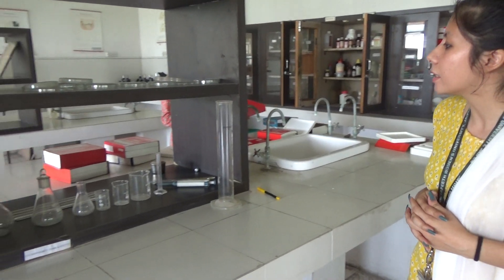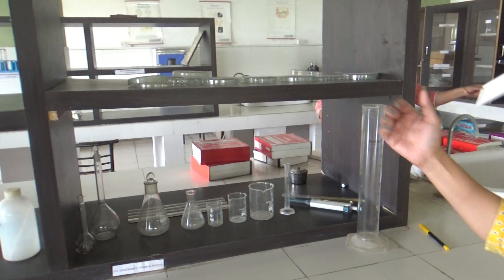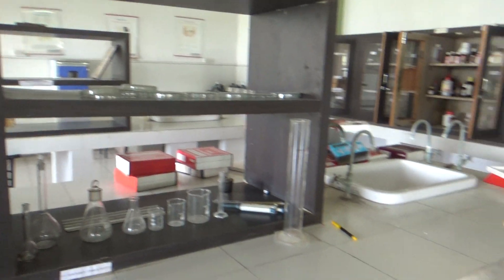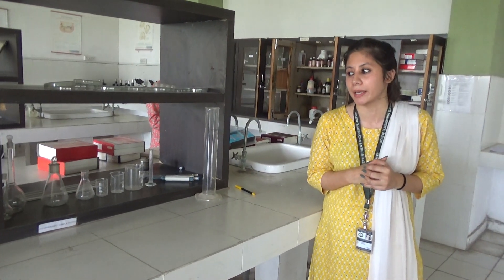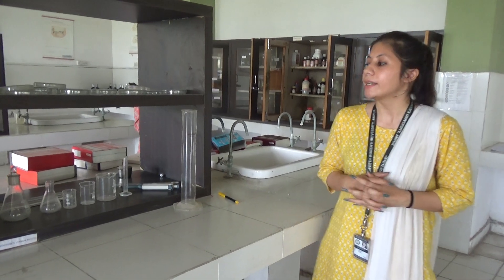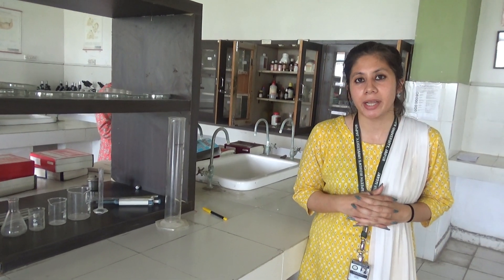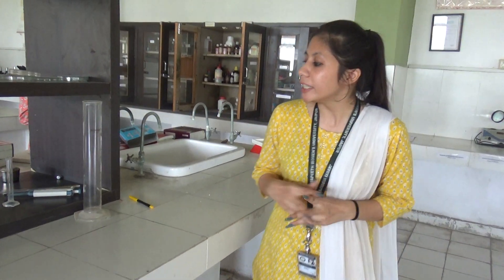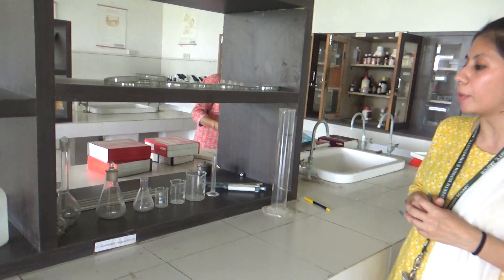First we discuss glassware and types of glassware. What are the glassware that you use in the laboratory? These are specific to laboratory use and they are highly expensive. These are the varieties of glassware that are used in the laboratory.